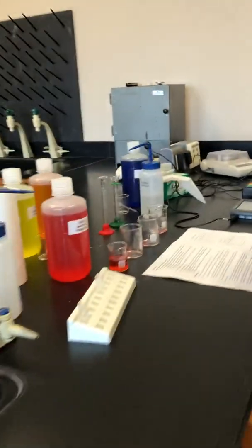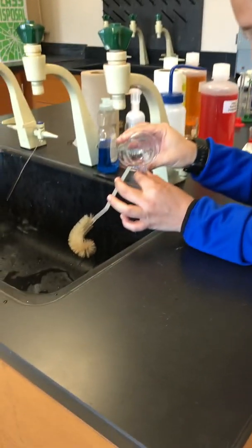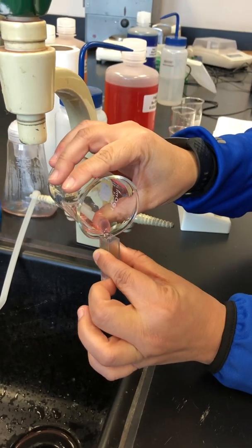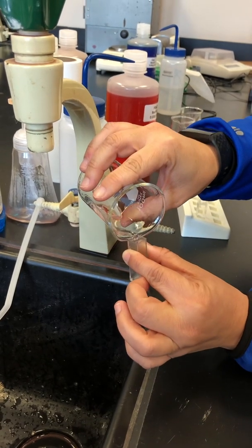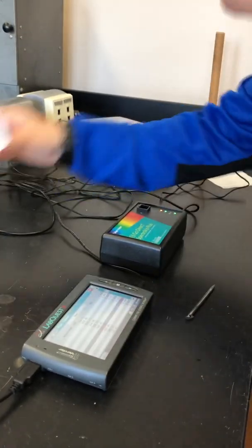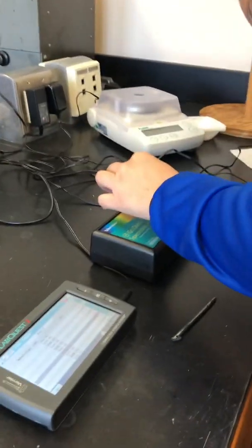So now let's get our last one. So last one is our most diluted guy, our 12.5. You can see he's a lot less red. He's almost got like a little pink color to him. I think we might have enough. I'll check. As long as it goes all the way in, we'll be okay. Yeah, it's high enough. We'll be okay.